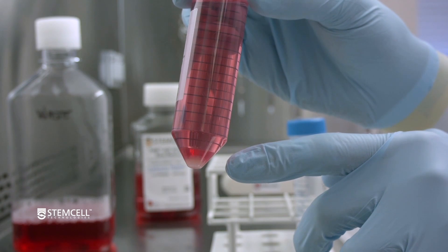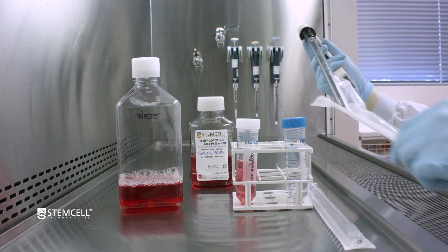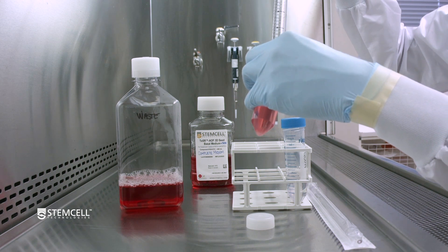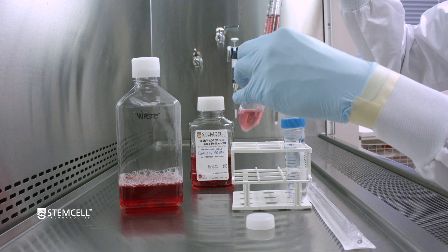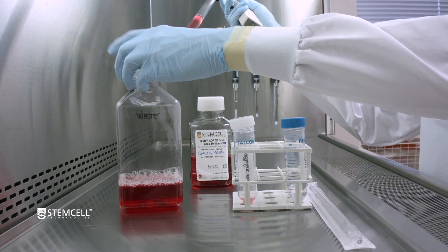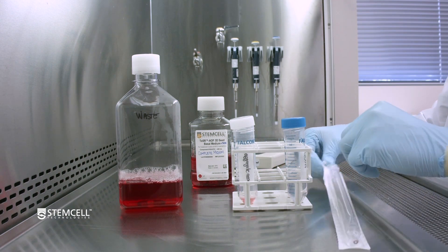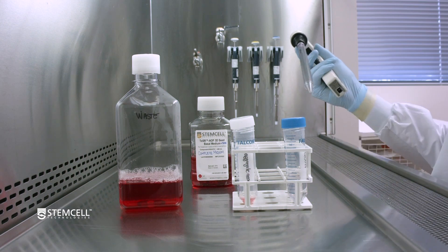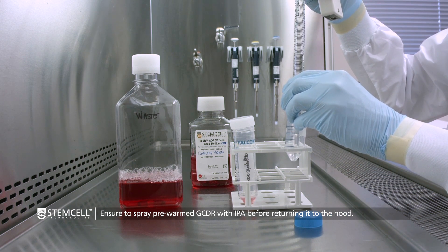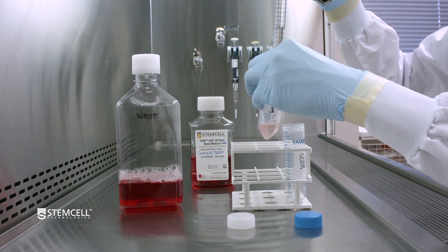Now the aggregates have settled. Carefully aspirate the spent media while leaving the aggregate pellet undisturbed. Next, add 20 mls of the pre-warmed GCDR into the aggregate falcon tube. Be sure to add the GCDR slowly.